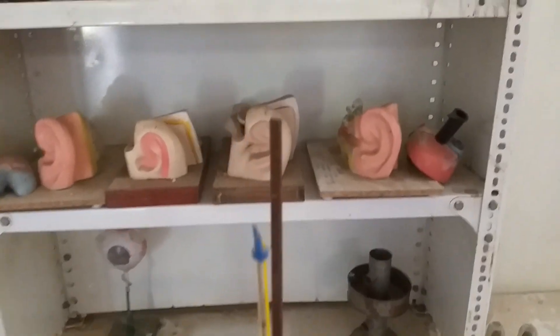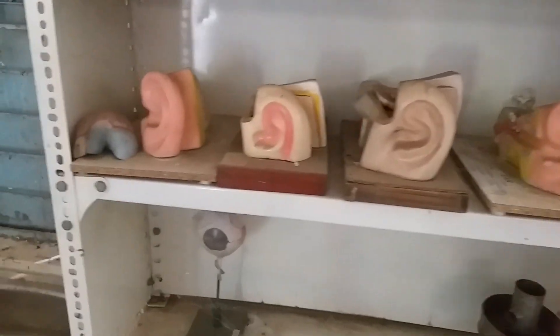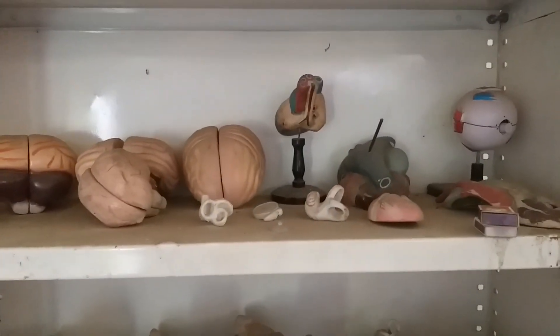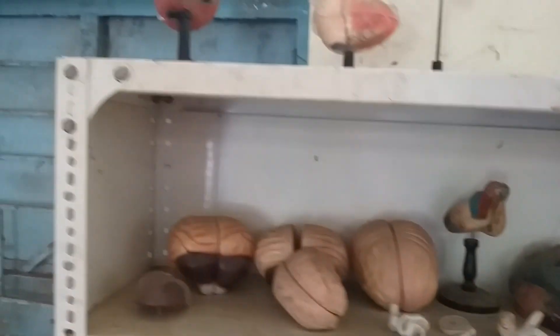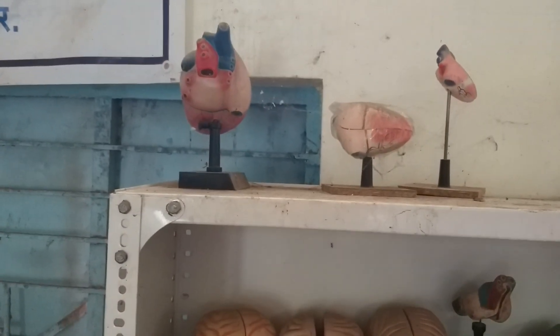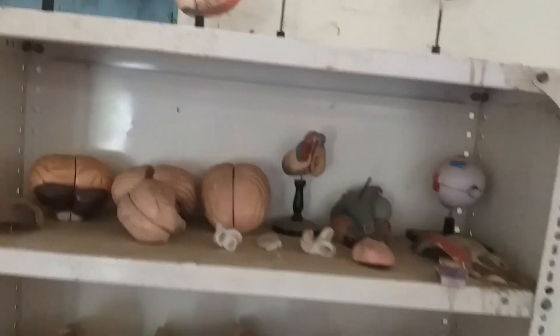These are some specimens of the human ear, human brain, human heart, and human eye. Some specimens — this is the apparatus called Kipp's apparatus.